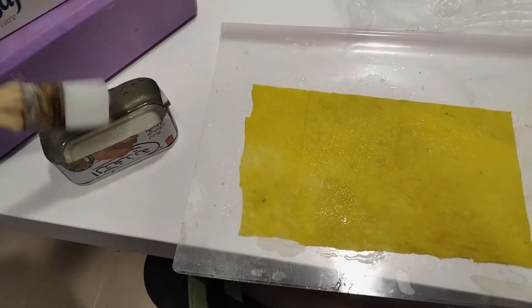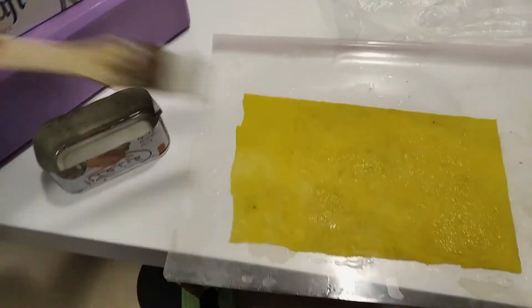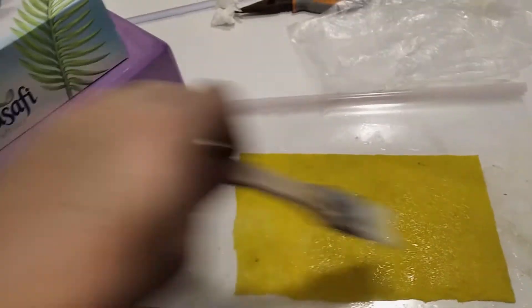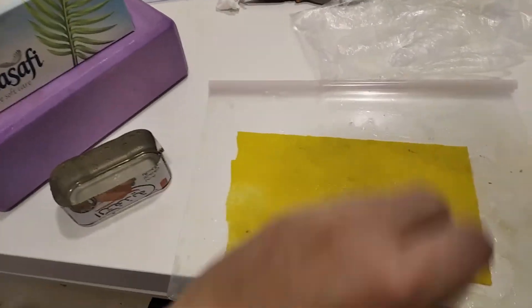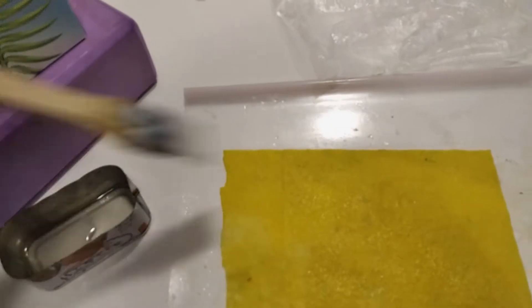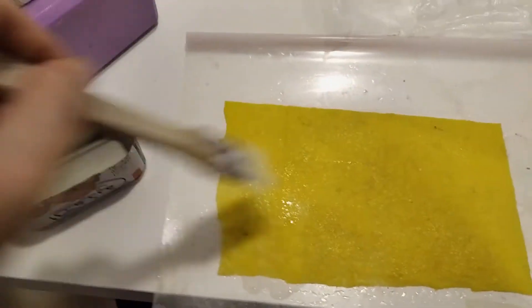You just paint it like before on both sides. The excess citric acid is good in this case because it neutralizes any sodium hydroxide that's still on the surface or in the polymer layers. Even if there is some that reacts, a little cross-linking during the second coat is not a big deal. You just don't want it to entirely gel up and become unable to get off the brush, which happens a lot when coating with borate. You're not going to face that problem with citrate cross-linked membranes.